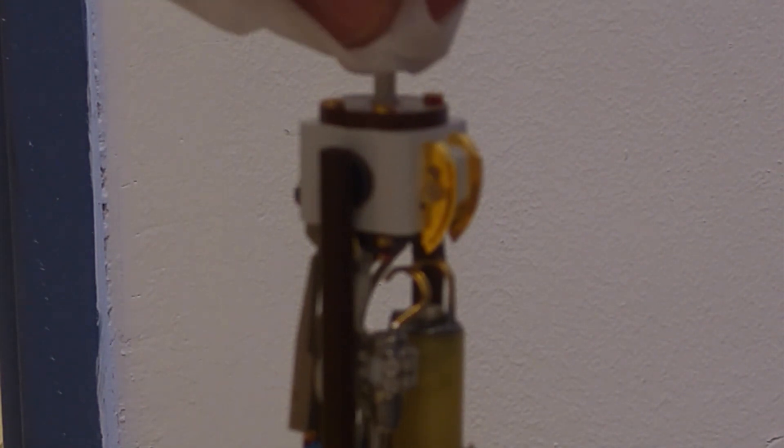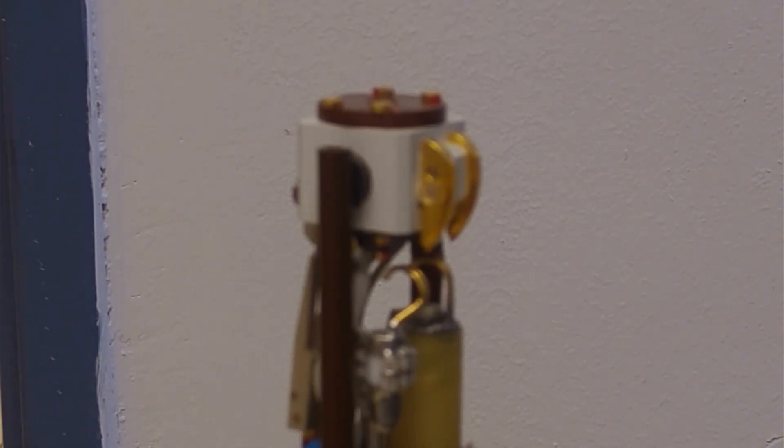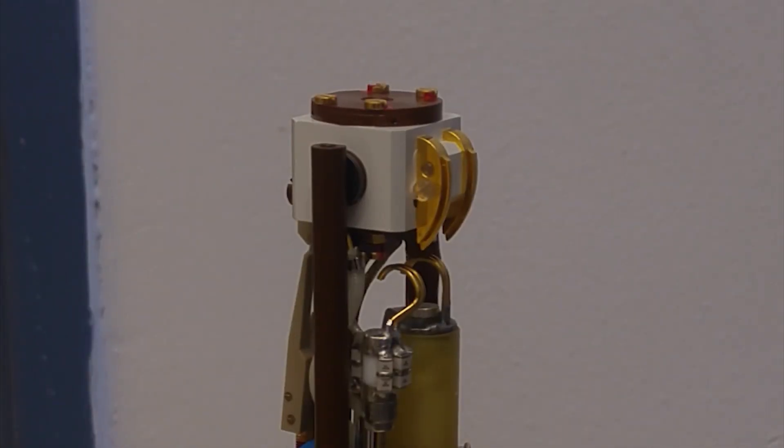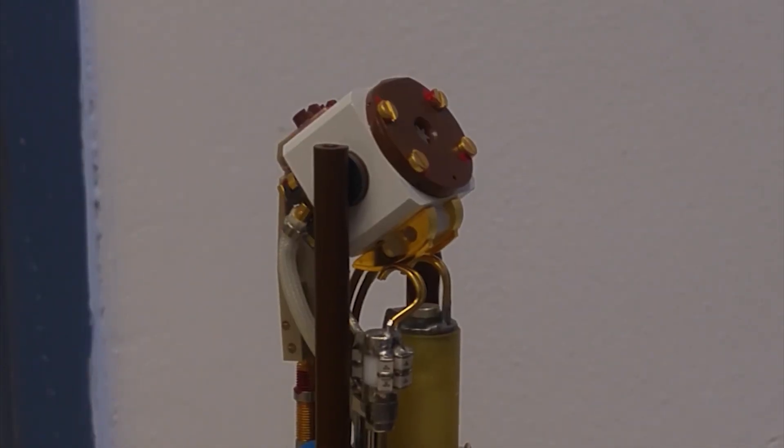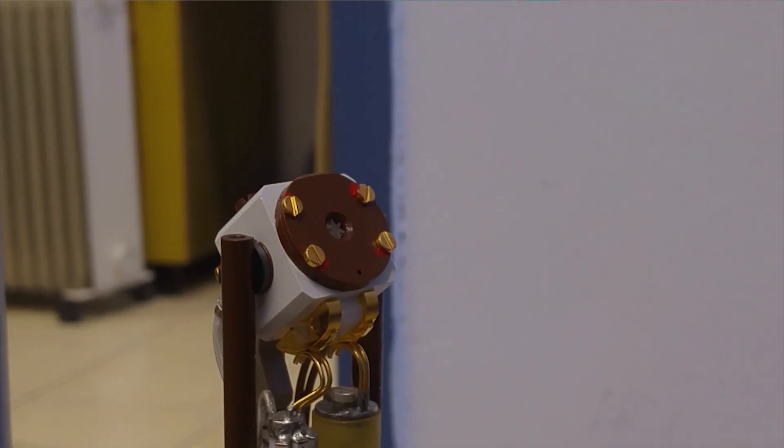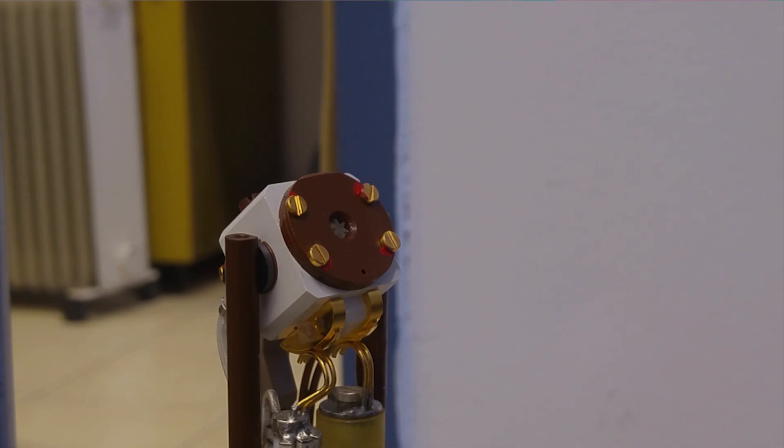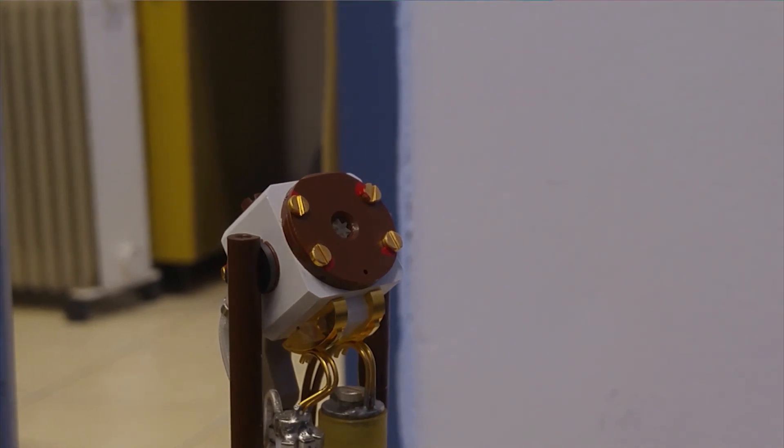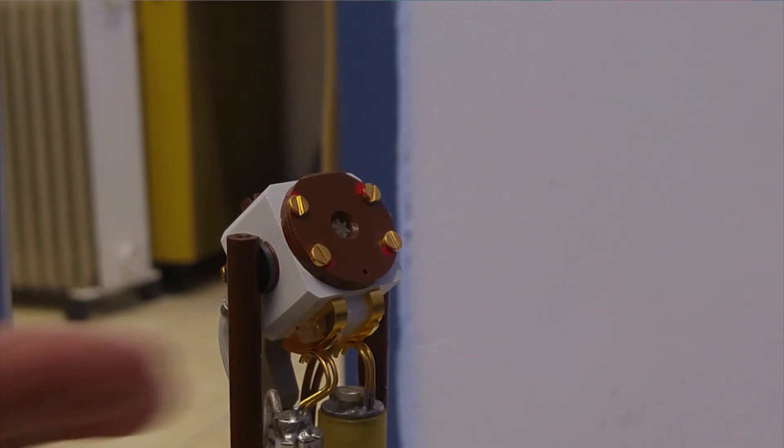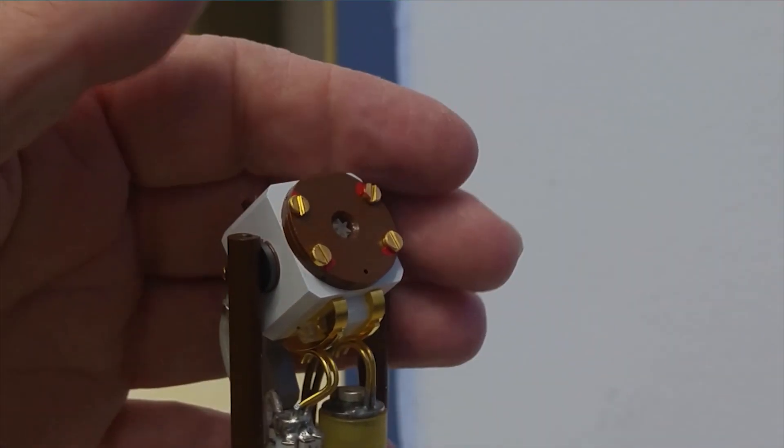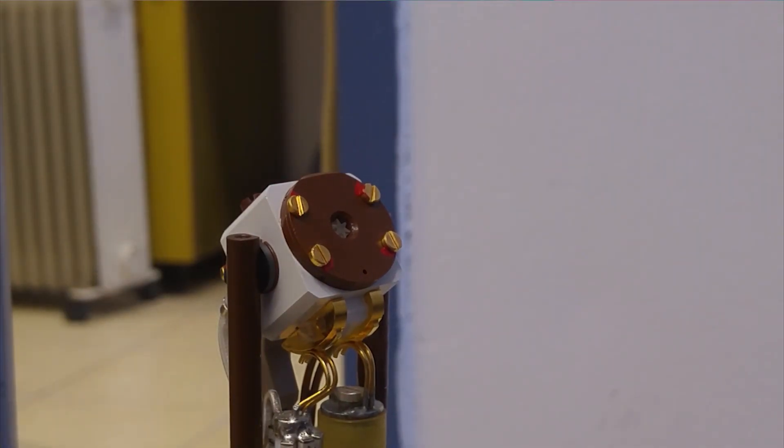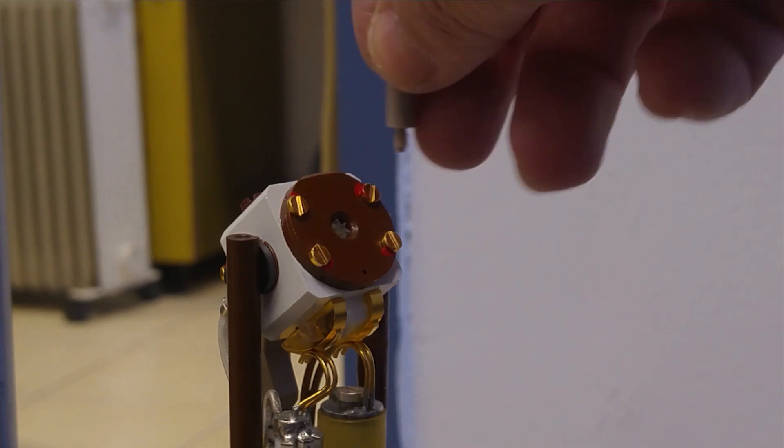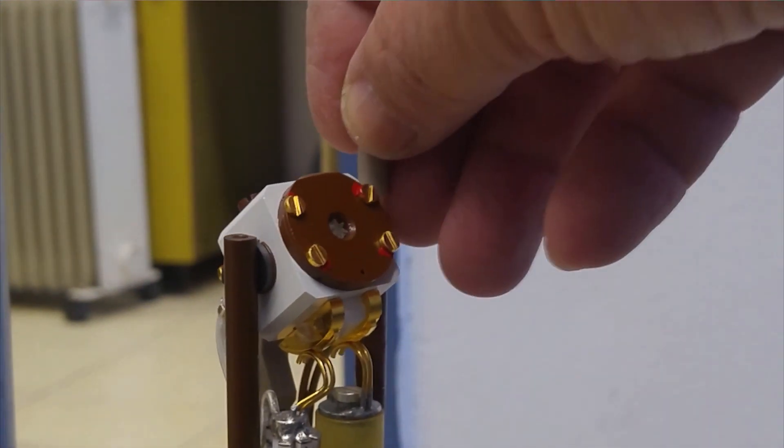Now we try the real test. Here is a rotor. Click on insert, wait a few seconds, and see if it goes into the right place. It takes 10 seconds, though. Right, that's now at the magic angle, approximately. Now, let's take a look into the rotor, and try spinning it. Of course it won't work. Of course it won't work. I have to put these in first. Otherwise, all the air escapes.